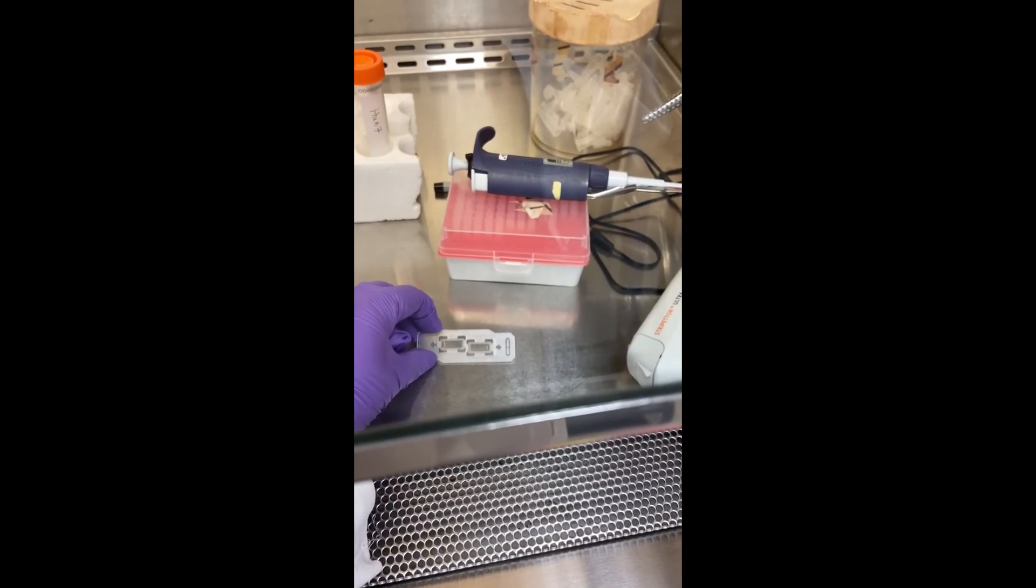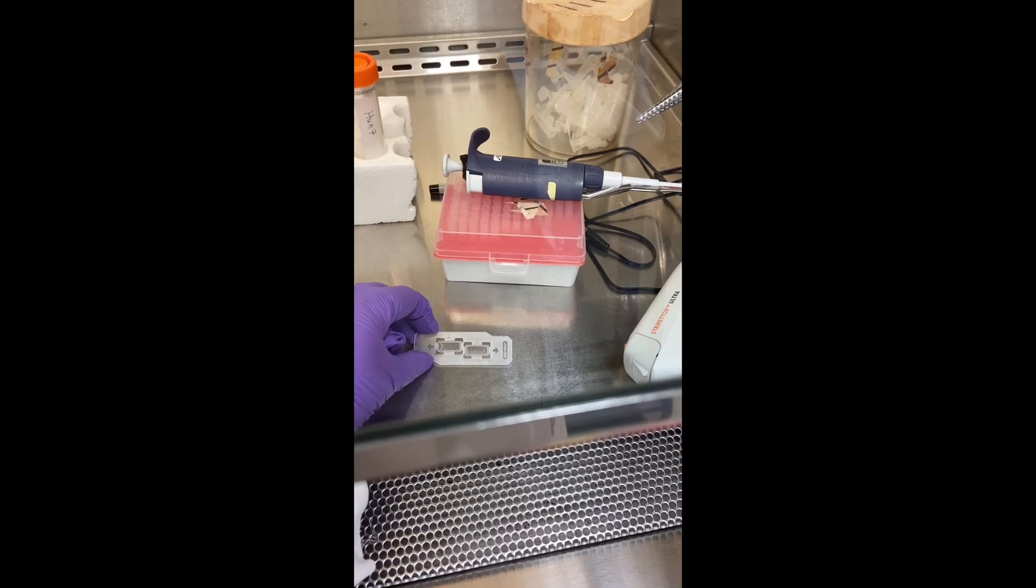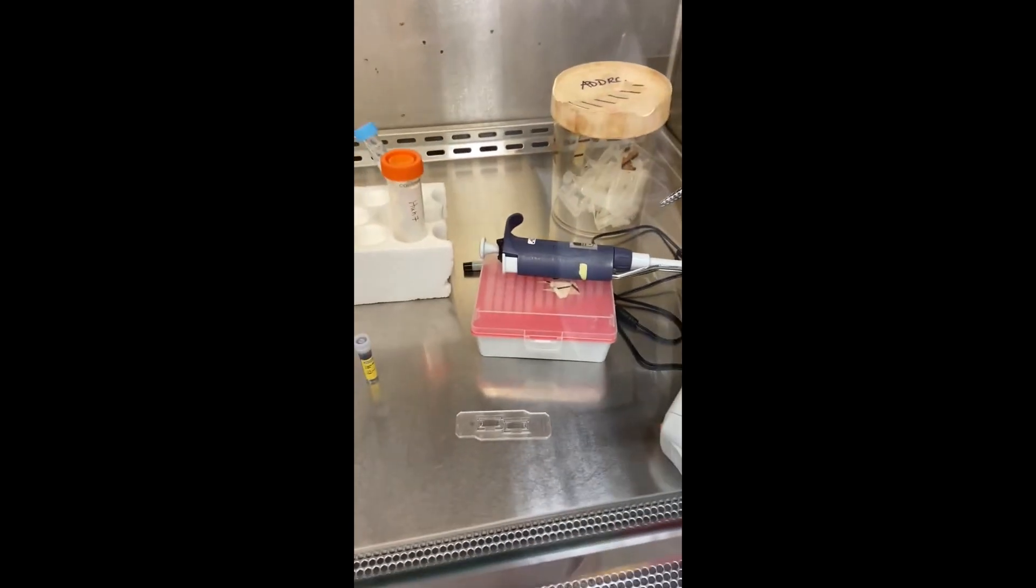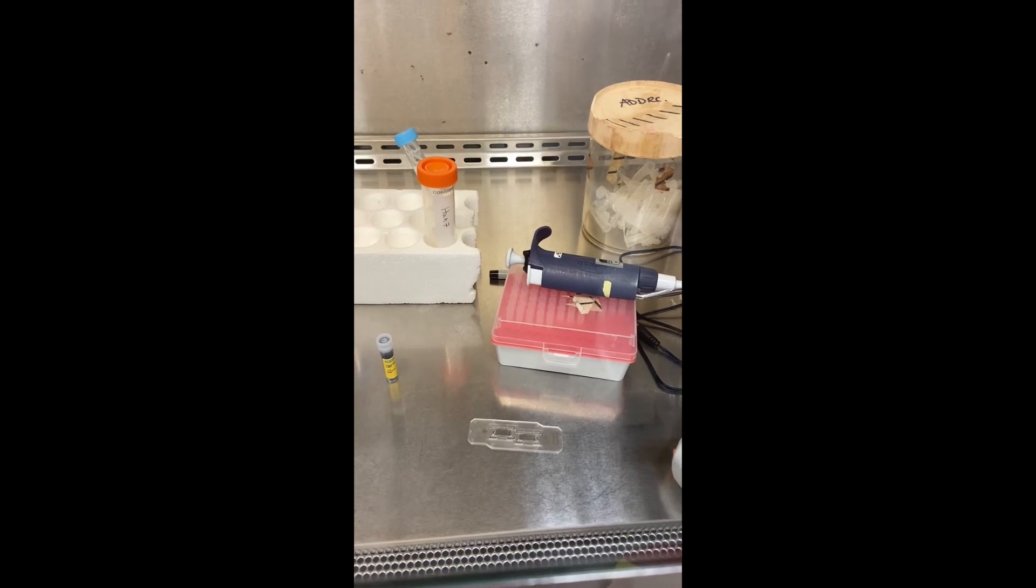So these are specific for the Bio-Rad cell counter, so you want to make sure that you have those. You cannot use any old slide.